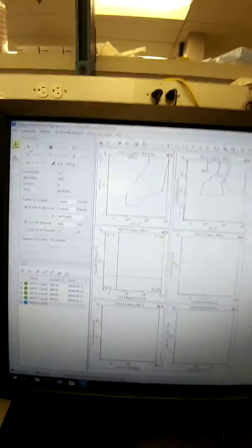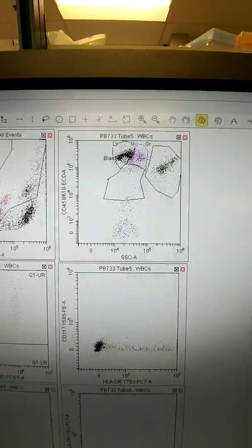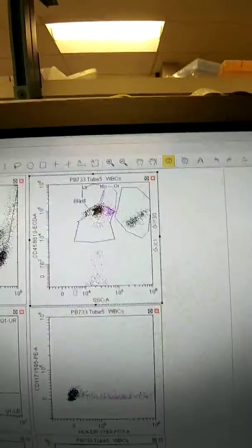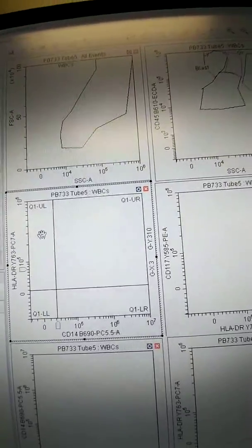Okay, so I've hit run. Oops, sorry, my bad. And on this, I noticed the CD45 looks like it's maybe a little bit high as well. So let's come click our hand with the G. Okay, and I want to bring this left click and drag it down just a little till it's at about 10 to the 5th. So there's that. Okay, and then we want to do the same over here with our DR. Okay, so our hand is still there. Left click and drag it down a little bit. Okay, still kind of high, so let's drag it down again.